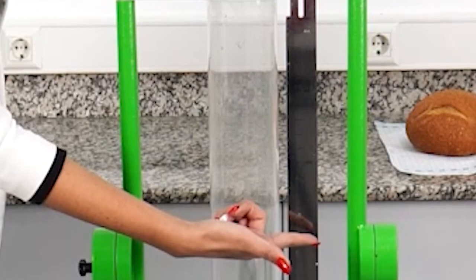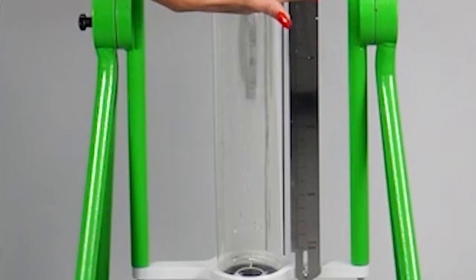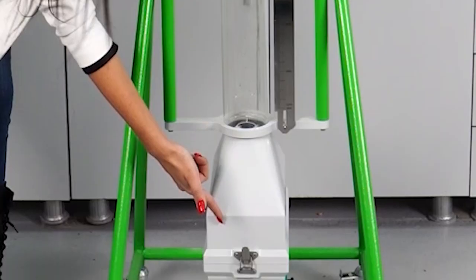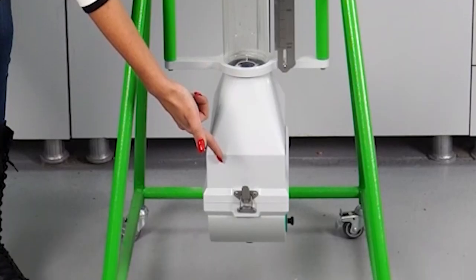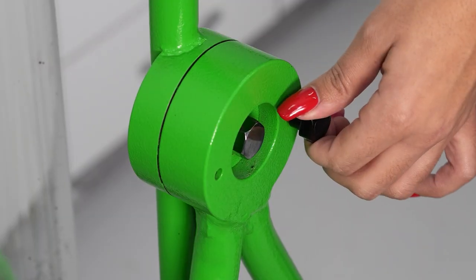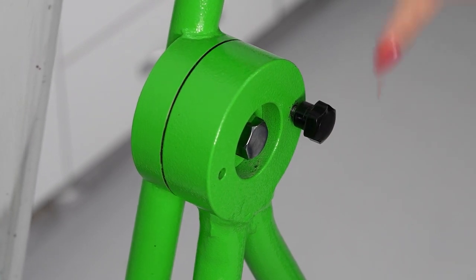The measuring ruler allows for the measurement of the volume of seeds spread through the transfer tube, hence measuring the volume of the bread. The second sample chamber is where samples of bread in roll form are placed. The motion pin initiates the rotation of the device and then ensures it comes to a fixed position afterward.